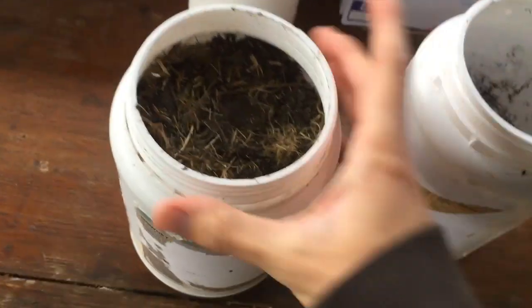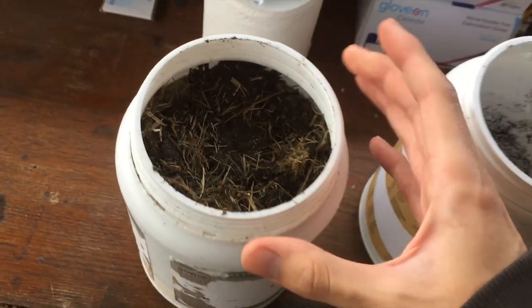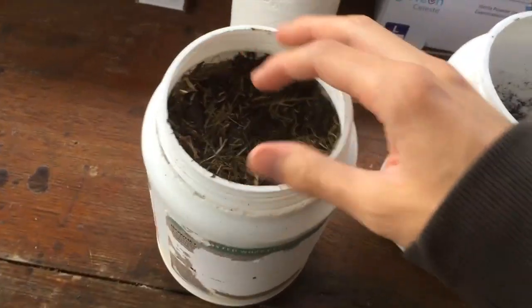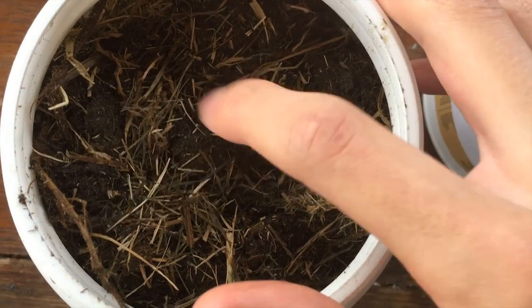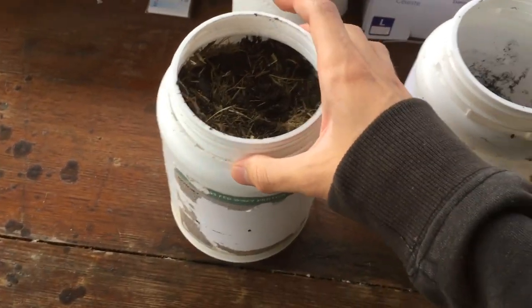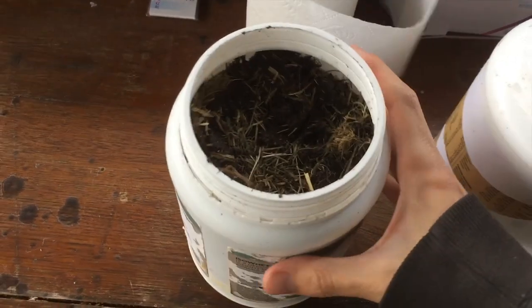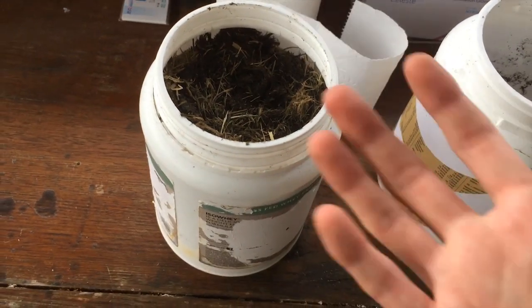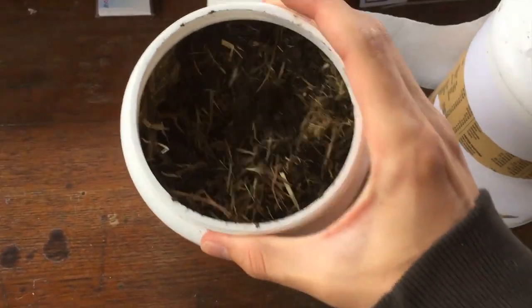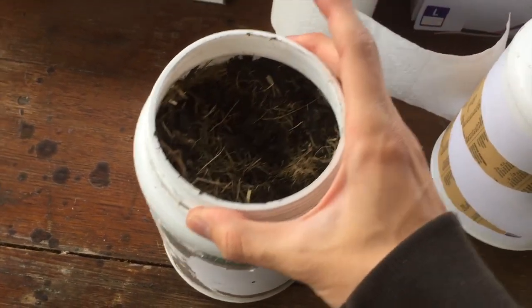It's not just any compost — this is grass clippings. I've got this compost bin where when we mow the lawn we chuck all of our grass clippings into it. The stuff at the bottom, all that kind of brown, disgusting stuff, has been sitting there for close to 10 years — that's like over half my life. Hopefully in those 10 years, being open to air, the nitrifying bacteria have done their magic and converted any nitrogen content in the grass clippings into nitrates, which we should be able to extract.